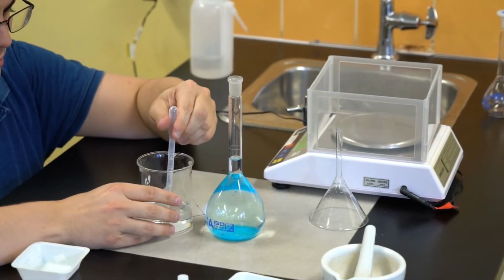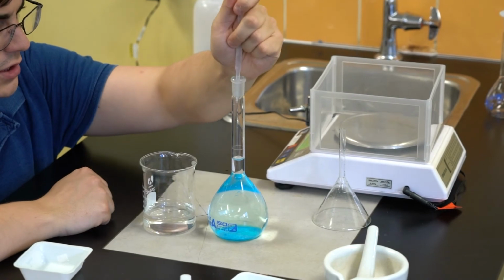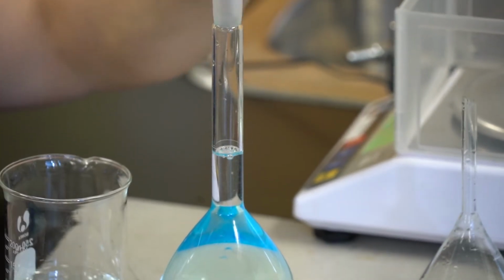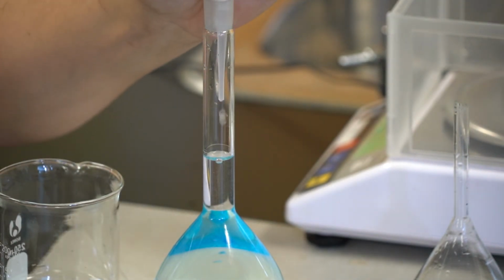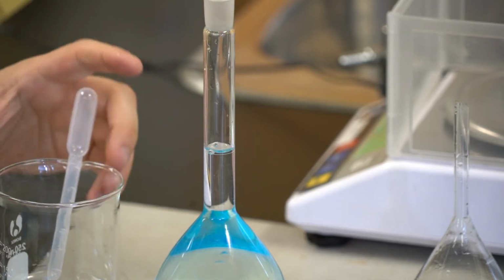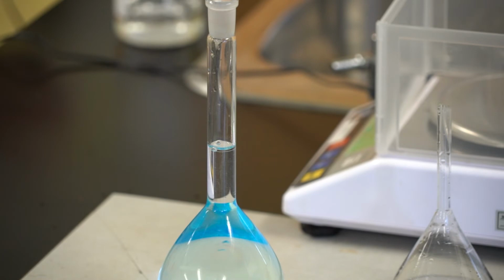And for the last part of this addition of water, I'm going to be adding my distilled water drop by drop using a transfer pipette. At this stage, what I'm aiming for is to have the lower part of the curve of my meniscus lining up exactly where the etch line is on the volumetric flask. Just a note as well, the etch line on that volumetric flask has been put on custom. Each volumetric flask has its etch line at a slightly different point. For this flask in particular, the line marks exactly where the flask fills to 250 mL. Generally, plus or minus 0.1 of a mL is the margin of error there.